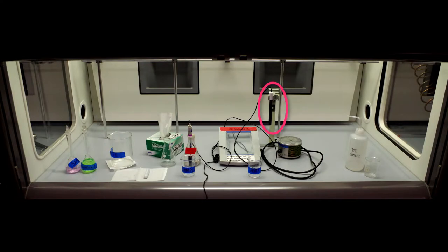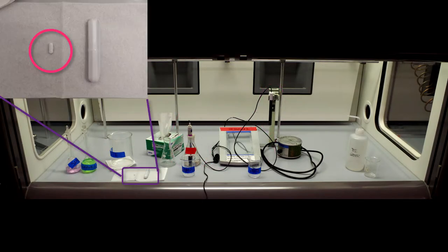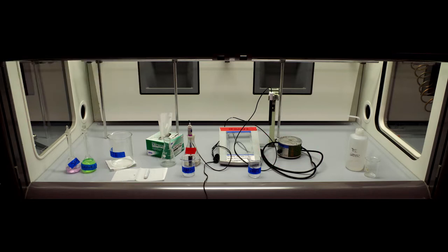You should have an ion selective electrode, a reference electrode, a potentiostat, a stir bar, a stir plate, and a stir bar retriever ready. As well, prepare a waste beaker and a beaker for your samples.